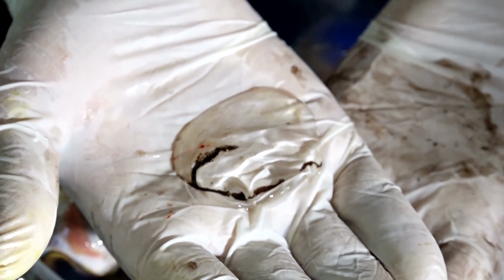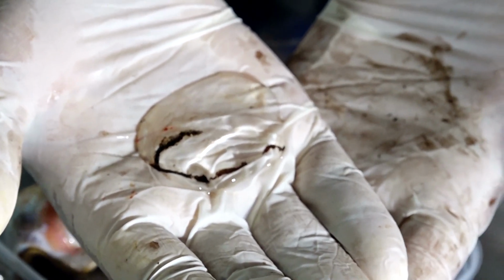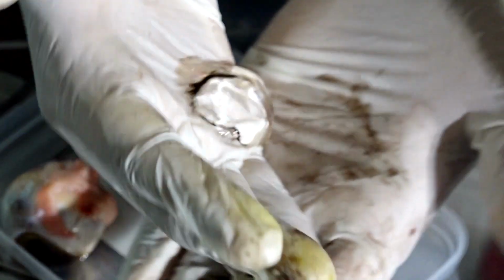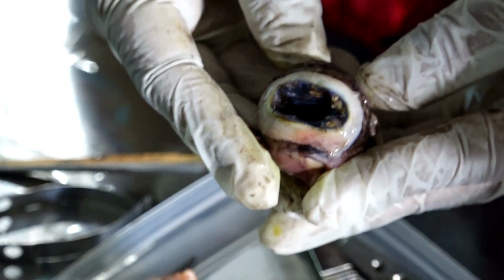Can you see the vitreous? Can you see it moving? Is it fluid? Did it run away like how the aqueous ran away? No, we couldn't hold back the aqueous, but we could hold this back. Why? It's a gel-like structure. So I want her to see this and tell me how is it? It's very soft, jelly form. And there's some attachment of the uveal tissue there. You can see that. So what do you think now is inside the eye?